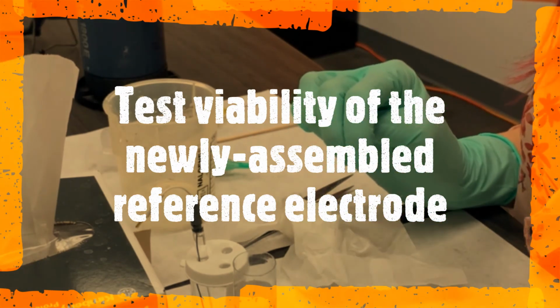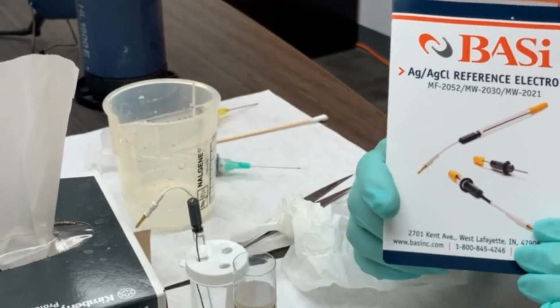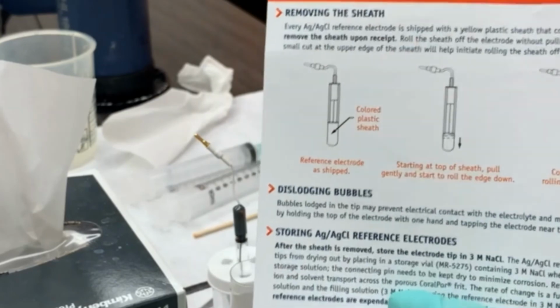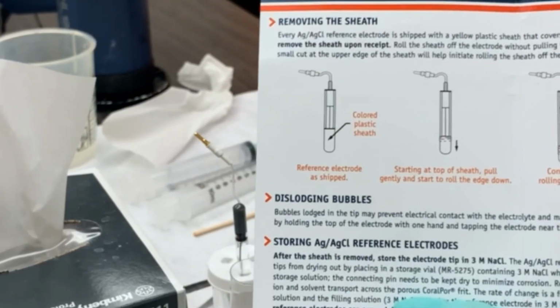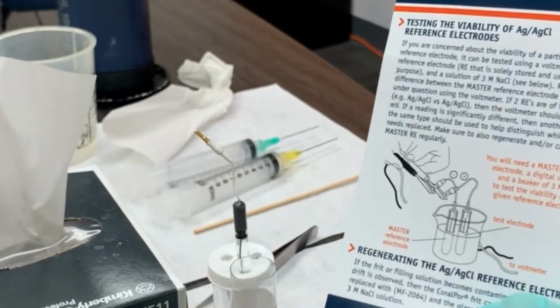For more information, you can actually check out the product insert that comes with your reference electrodes. It shows you how you can remove the sheath of your reference electrode, how you can store it, but also how to do the viability test.